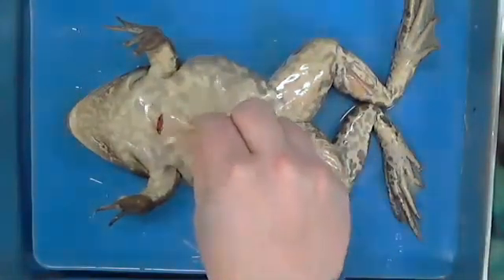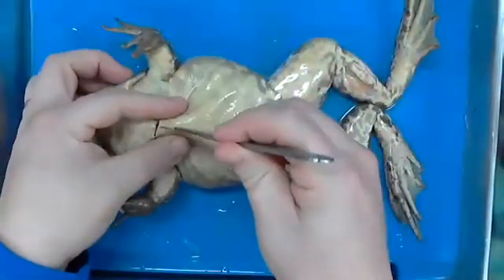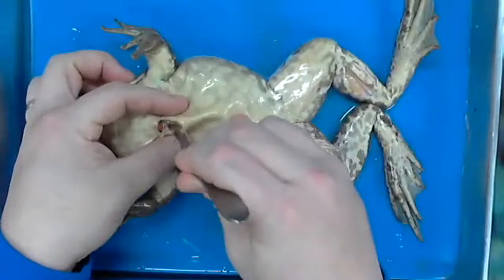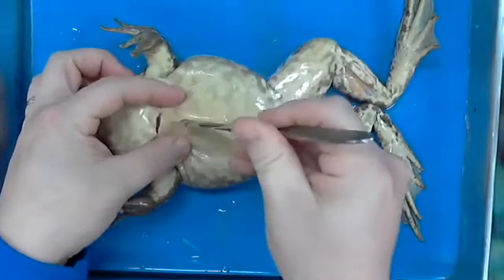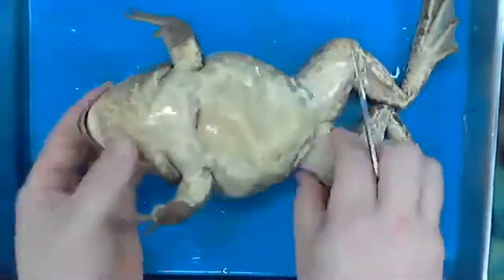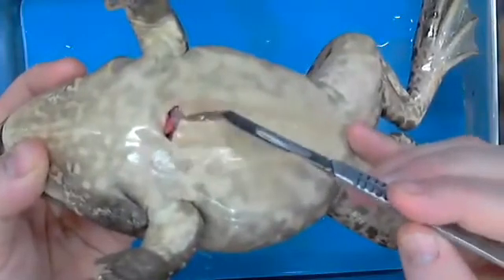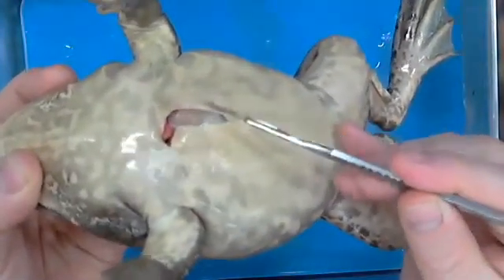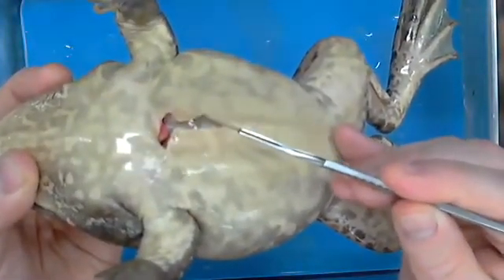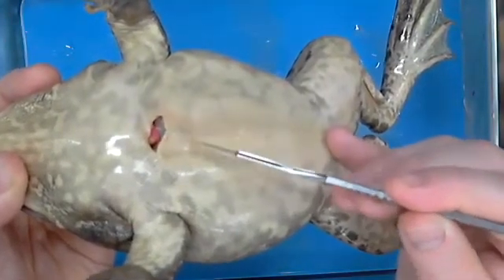So real quickly, what I'm going to do first, because it's already like this, is I'm going to take his skin and get it out of the way. You can't feel this because you're not here, but I'm going to try my best to kind of give you a good example of this as I show you. Everybody take a look at this skin and notice how thin this is. Anybody want to guess why?